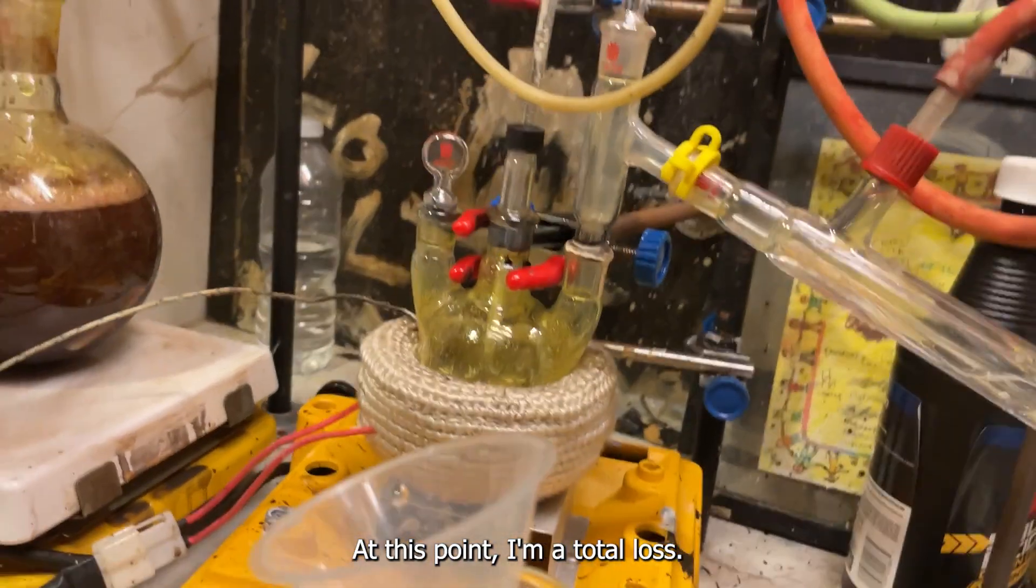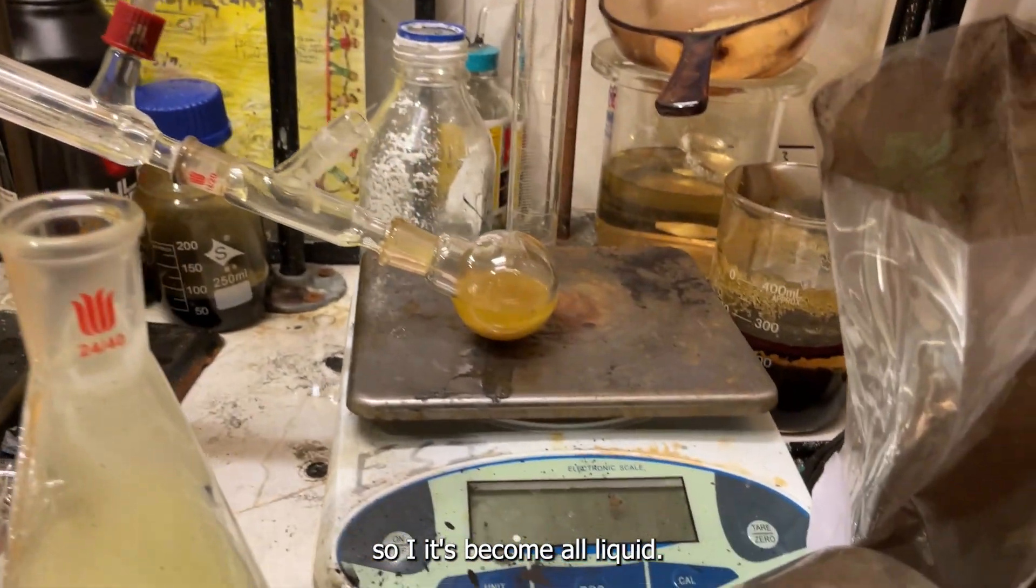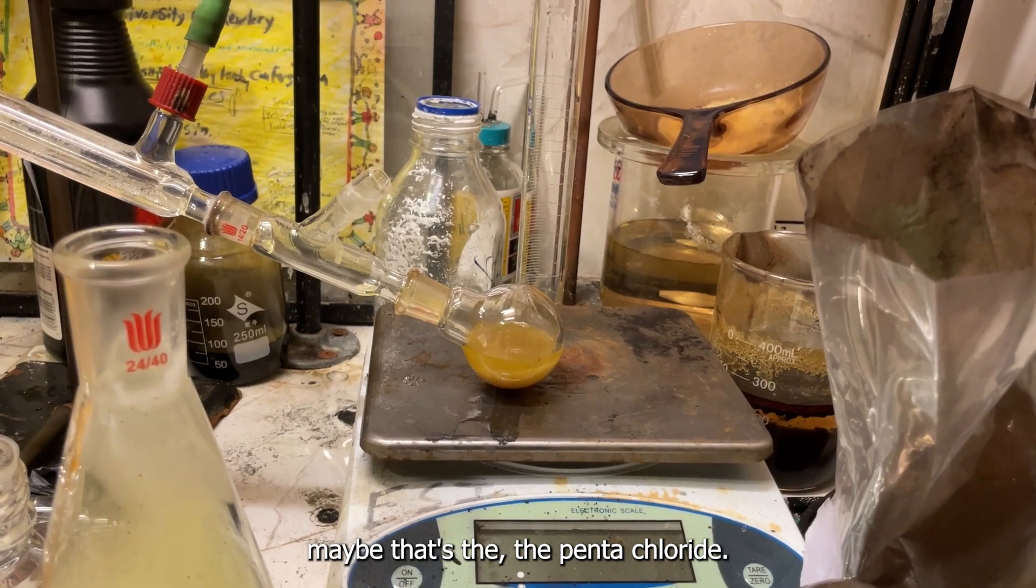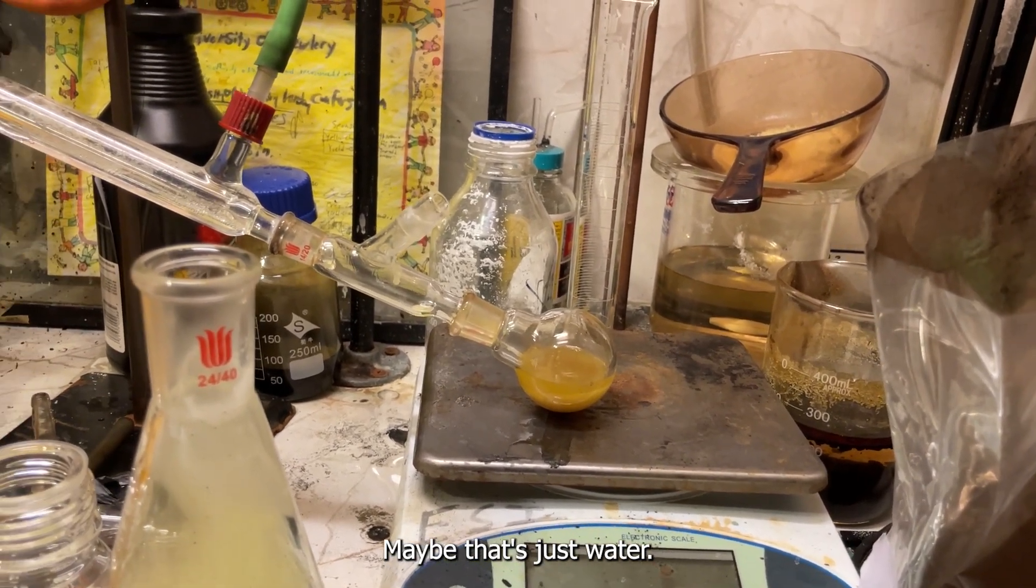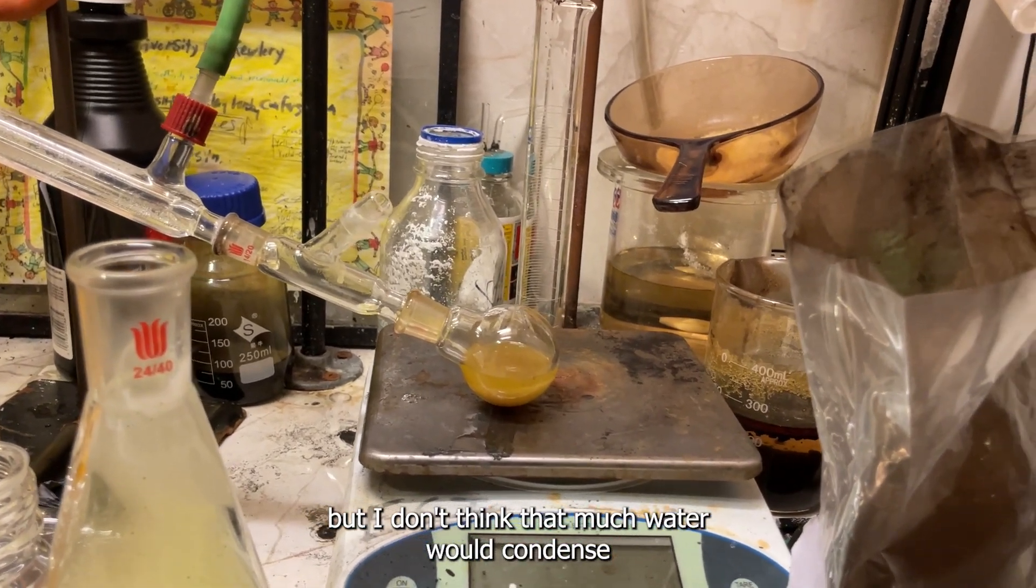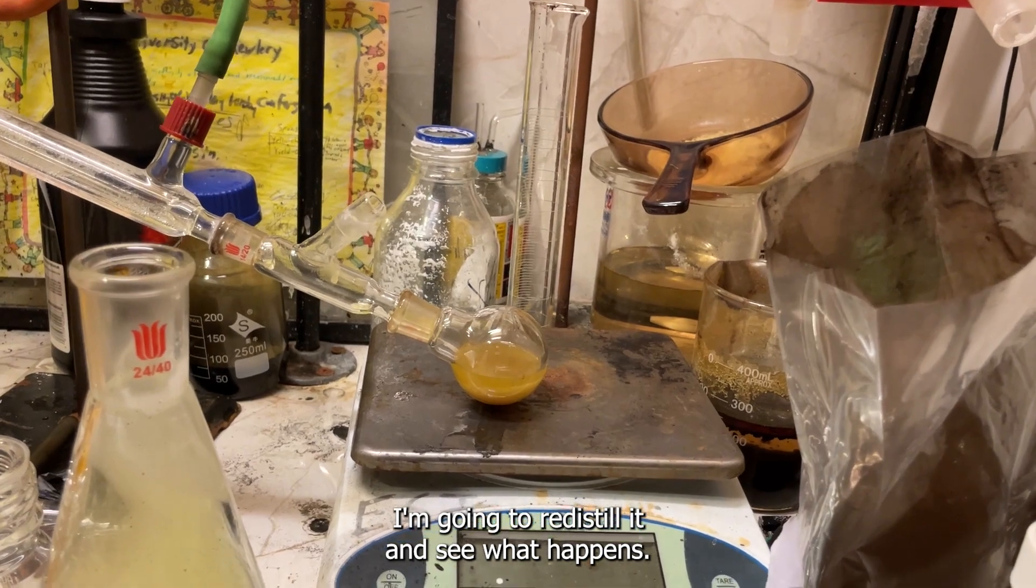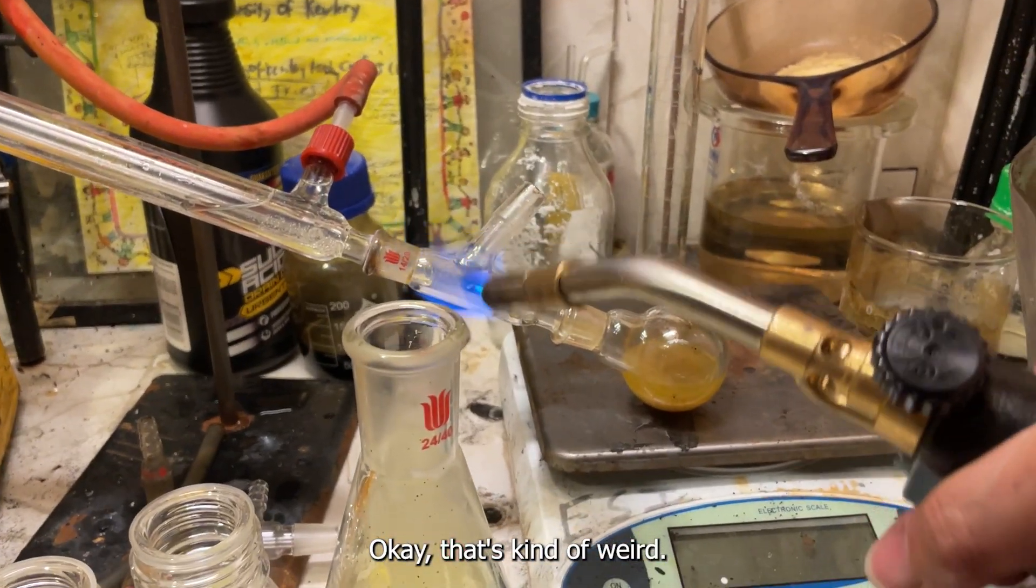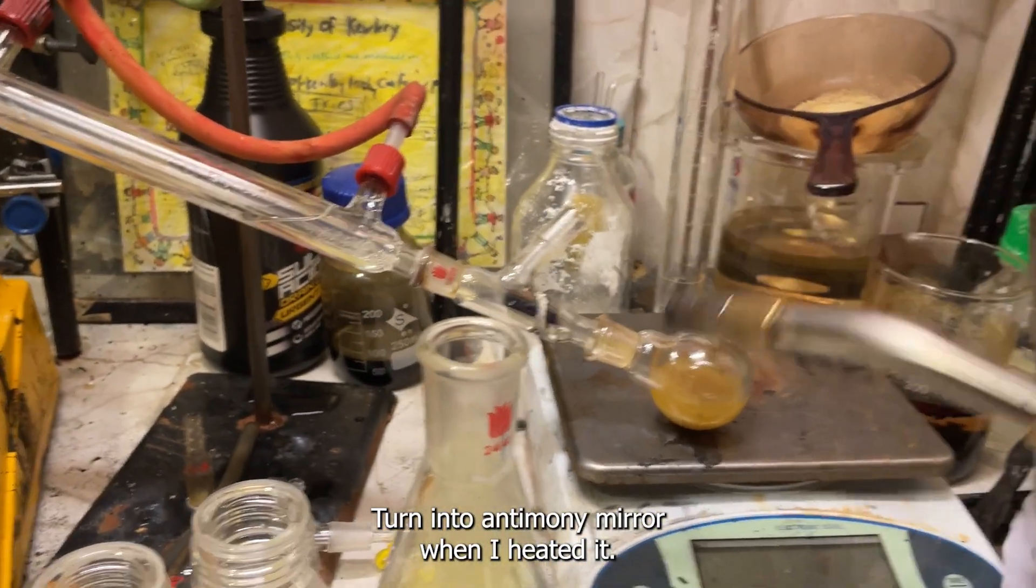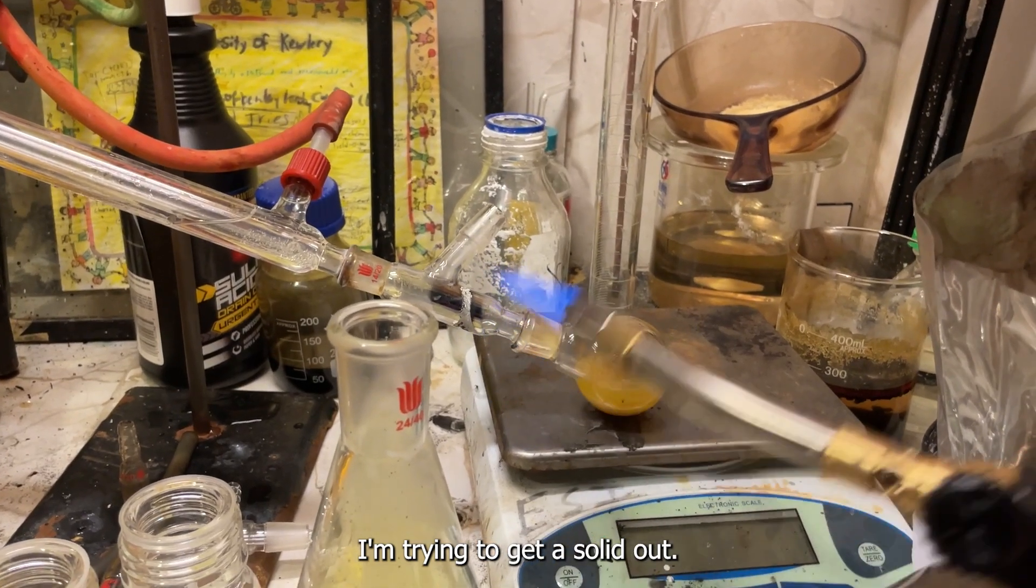At this point I'm at a total loss. So it's become all liquid. I don't know why. Maybe that's the pentachloride. Maybe that's just water. There is a chance it could just be water that got over. But I don't think that much water would condense enough to liquefy the entire thing. I don't know. I'm gonna reseal and see what happens. Okay, that's kind of weird. Turned into an antimony mirror when I heated it. I'm trying to get the solid out.